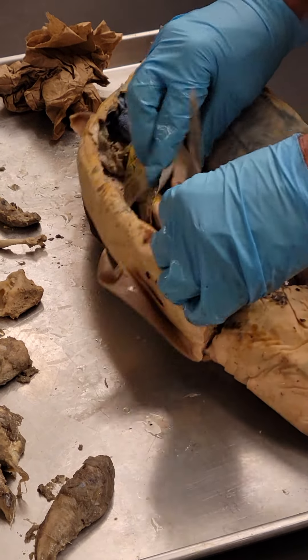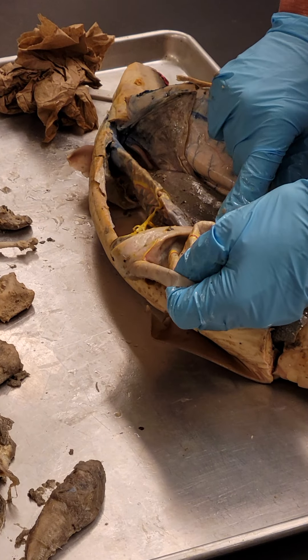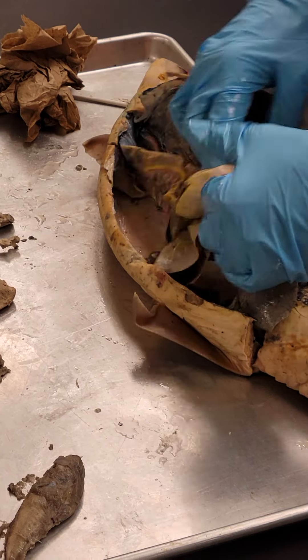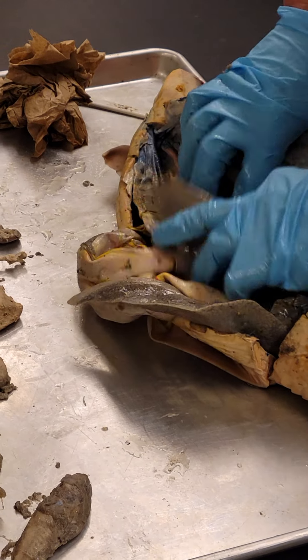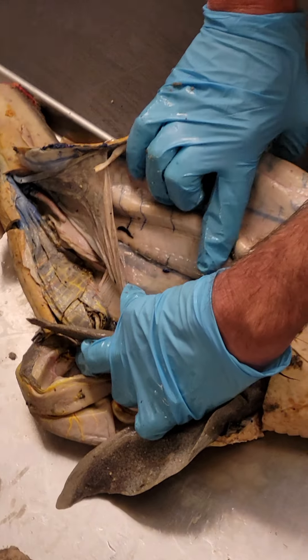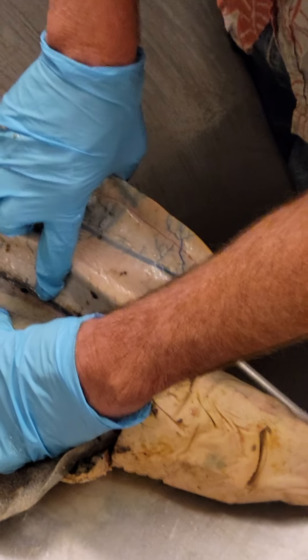Good test questions: stomach, duodenum, pancreas, ileum, rectal gland, spleen. The kidney is not super obvious — here's a better view. It's kind of a brown line on this side, right along the edge of that blue cardinal vein.